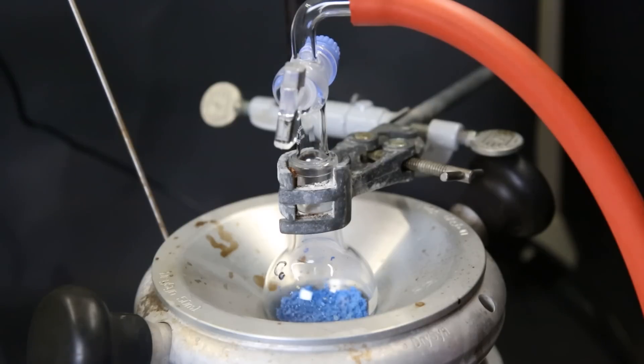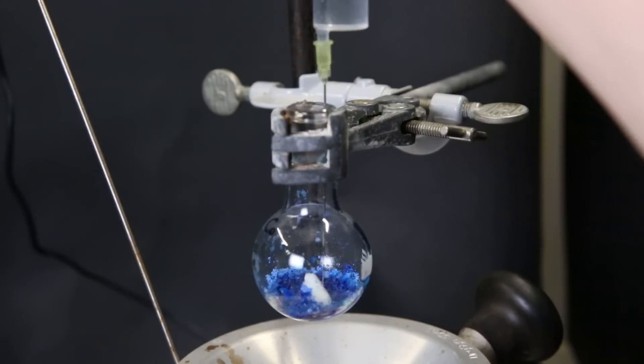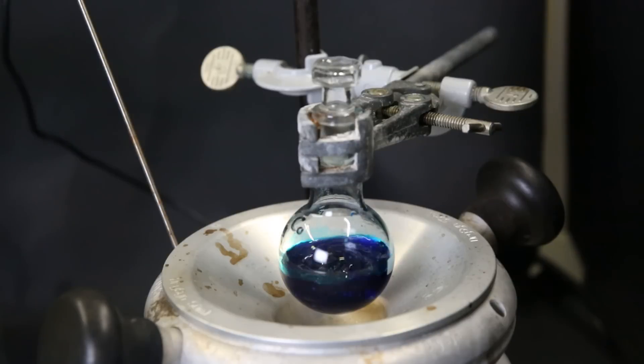After a while, it looks like it is completely dry, and I can move on with the next step, which is dissolving the salt. So I add a stir bar and then add about 20 mls of degassed and dried DMSO. I then allow it to mix for a while until no more solid is left at the bottom.